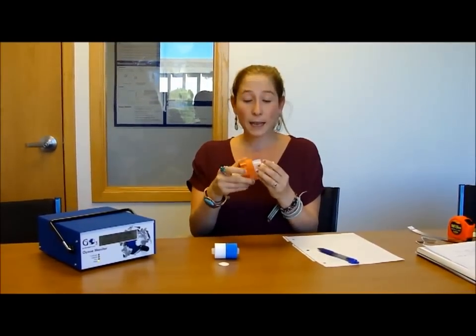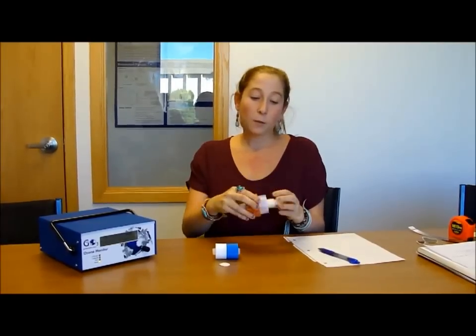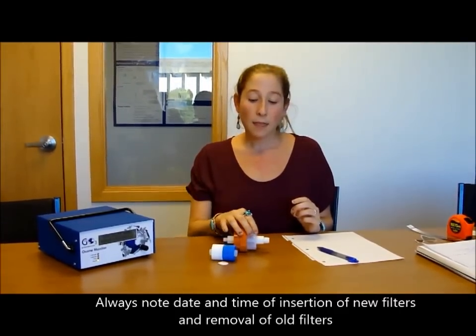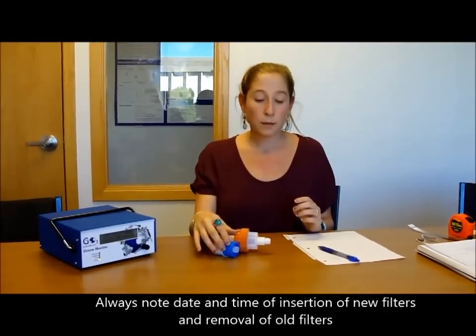You're going to make sure that that's airtight, screw it back in, and take note of the date and the time that you started the sample. So today's date, October 18th, 2 o'clock, and you're going to wait for a couple of weeks. Check back periodically, and eventually the filters should start to darken as they collect black carbon.